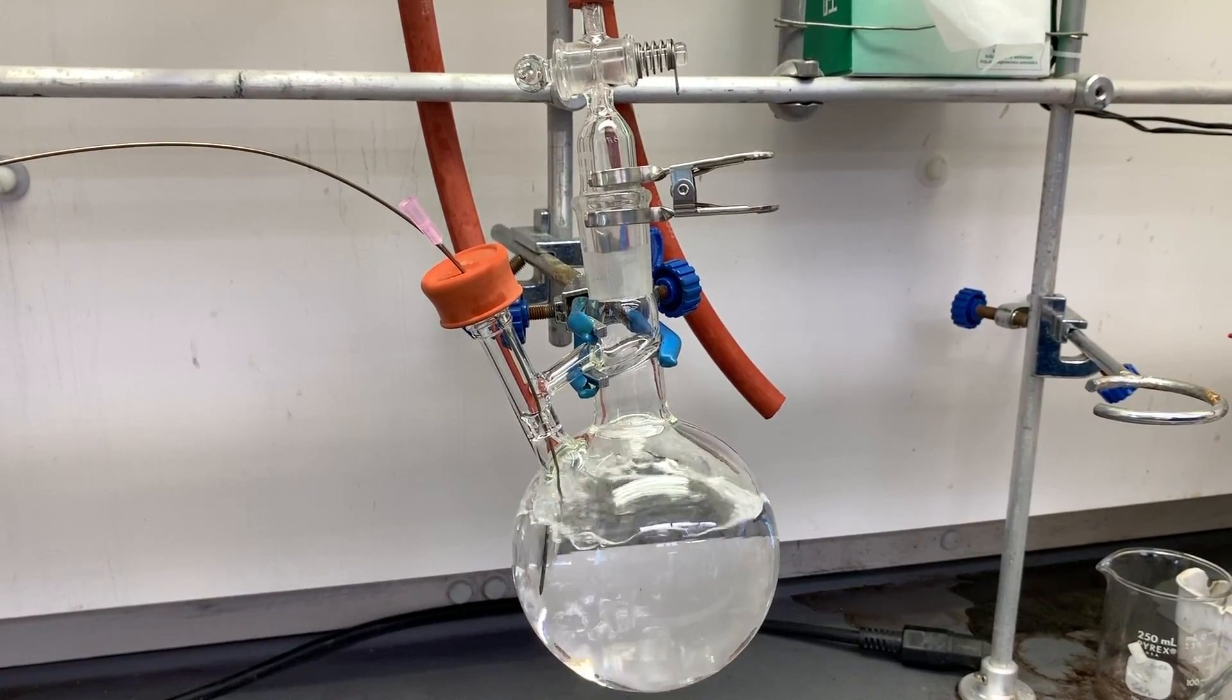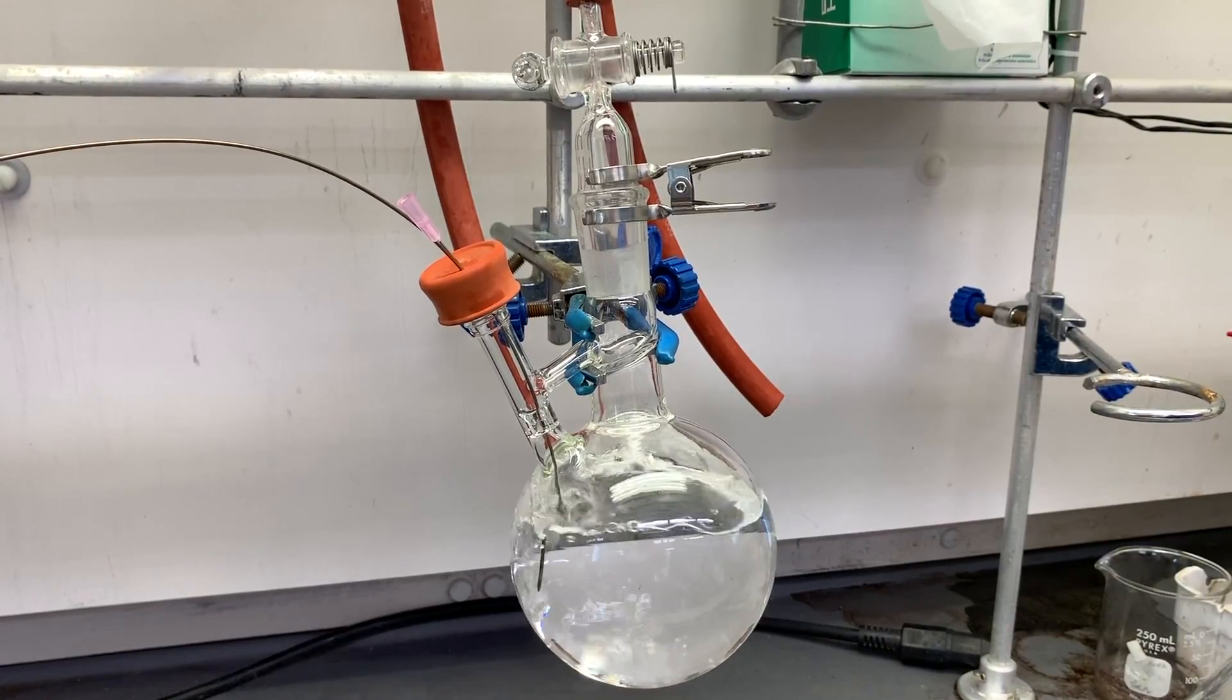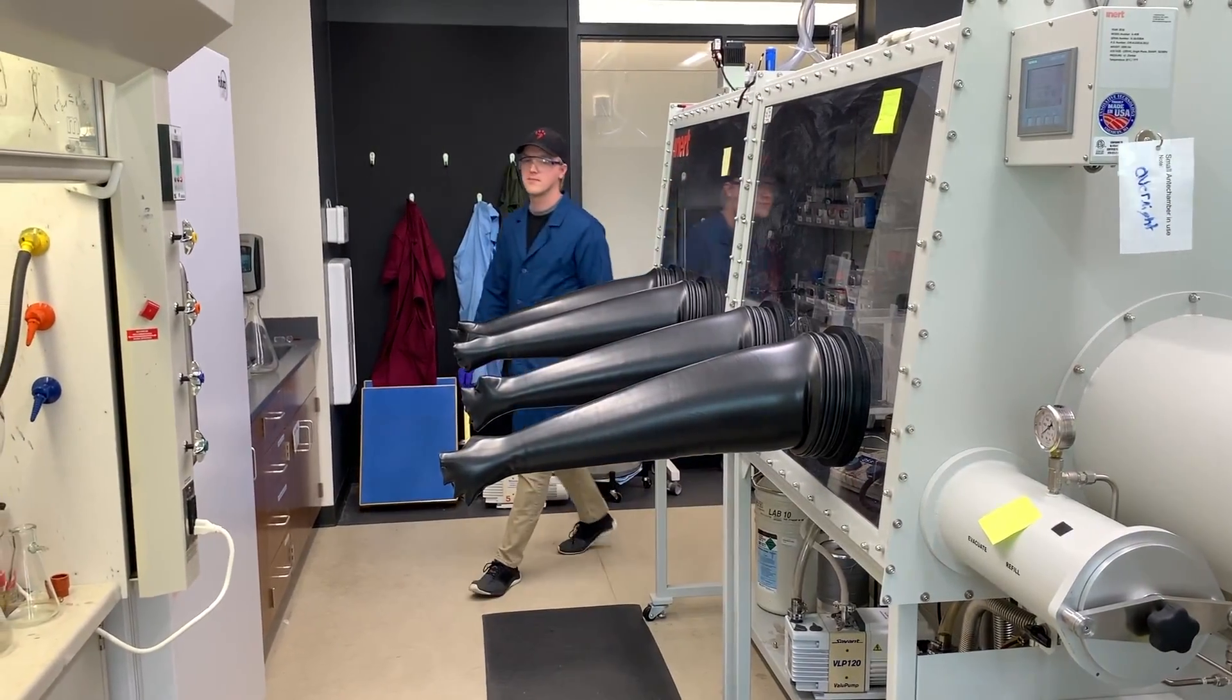By displacing oxygen with pure nitrogen gas and by bubbling nitrogen somewhat forcefully through the liquid, we can eventually drive away oxygen from the liquid. Now, let's see how Nick does this.